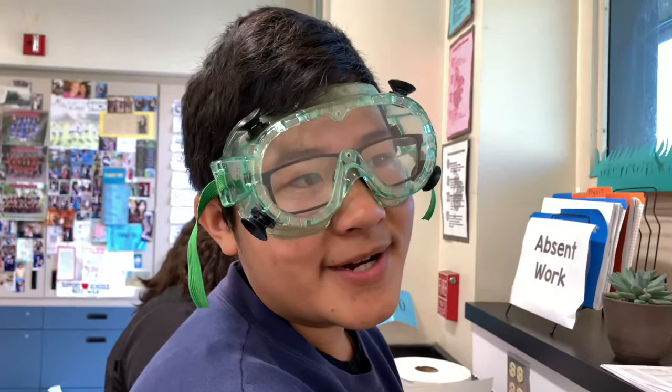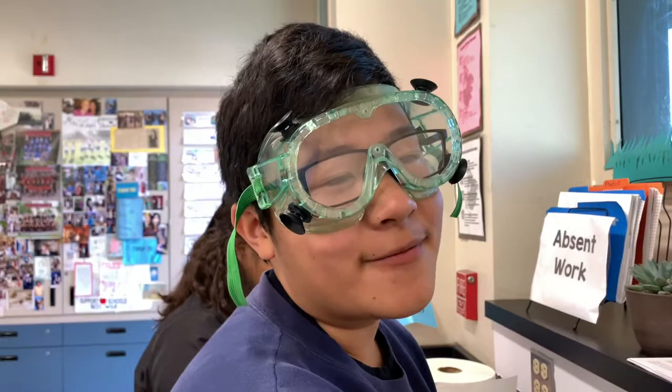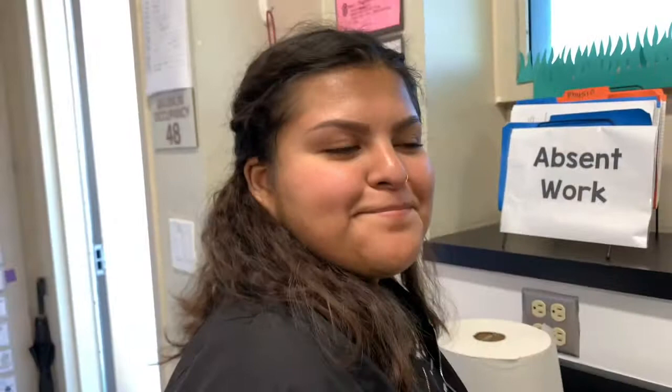Day two was similar to day one — it went okay. I really want to find the reproductive system, though; that's day three. I think it went pretty well. It was interesting to see the lungs and heart. Day two was a little more confusing than day one, because a lot of us had more questions about where things were, but it was about the same overall.